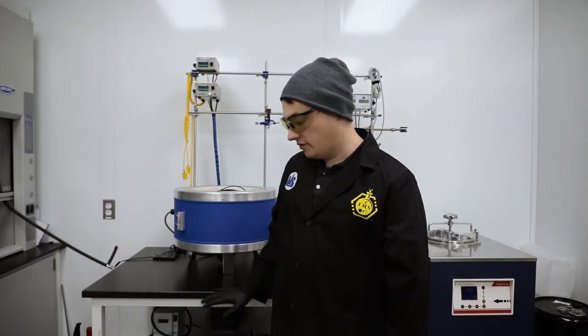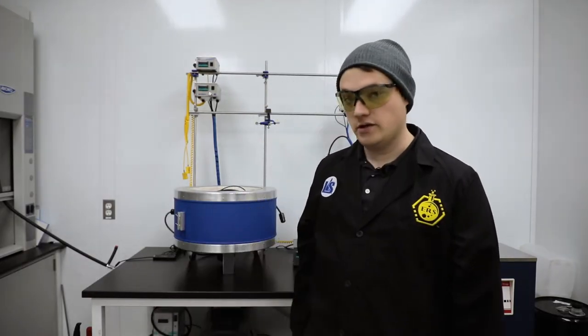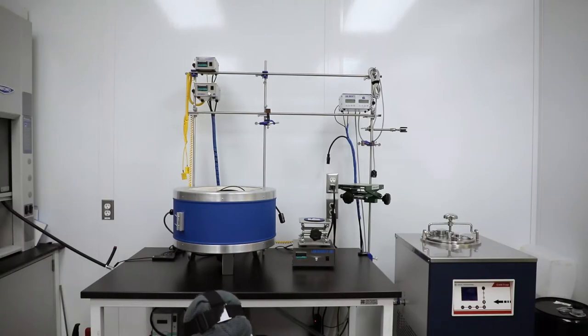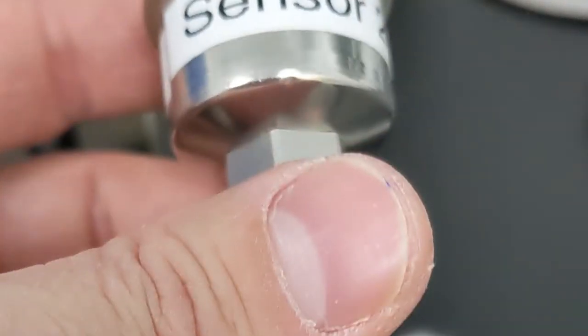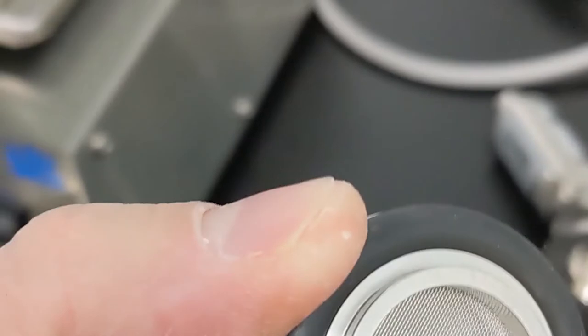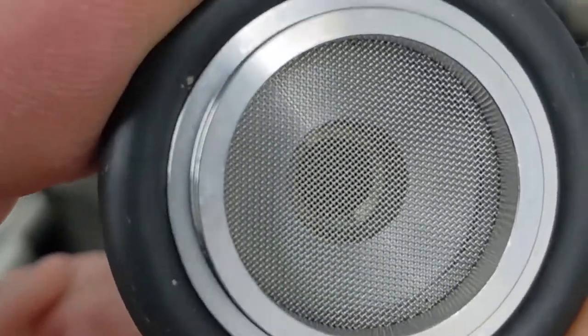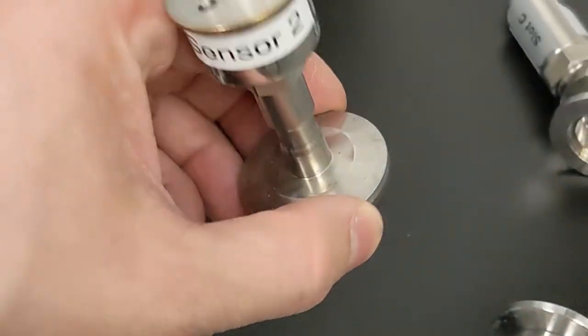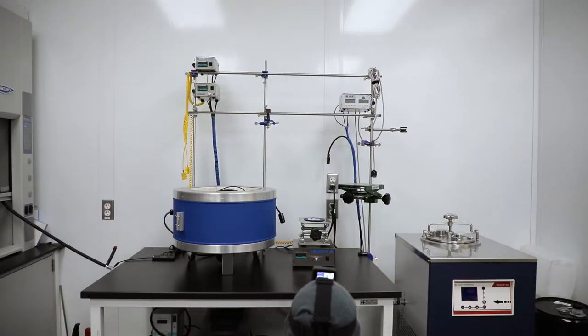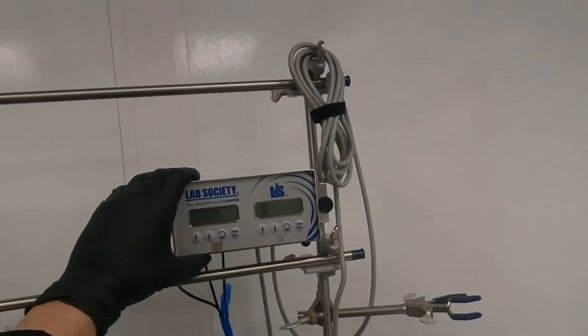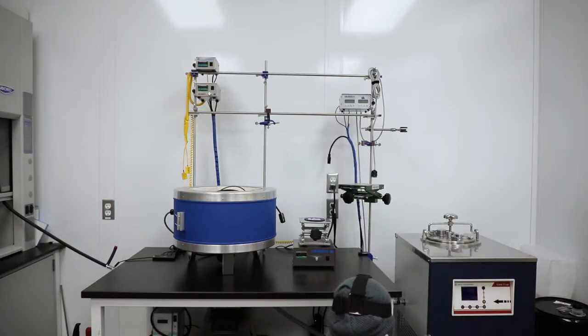First thing I'm going to do is use my tool chest here to find what I've got. I've already assembled this portion here. Whenever you're using one of these welded KF25 sensors you want to make sure that you're using a screened o-ring gasket here and the reason for that is it protects gunk and stuff from getting up inside that sensor. For this application I'm going to use sensor 2 which corresponds to my digital PBM2 right here and I'm going to install this on the pump.